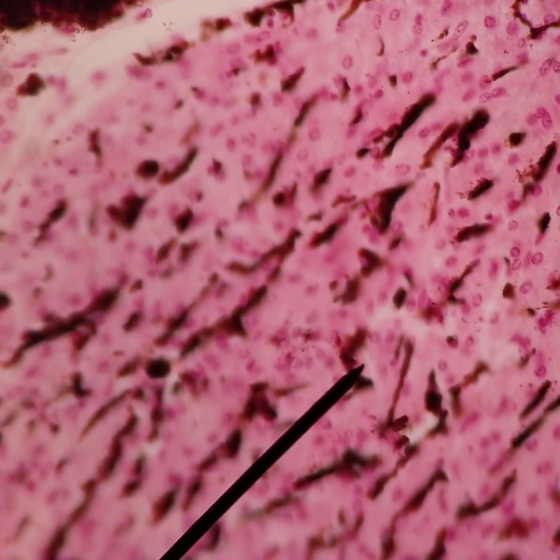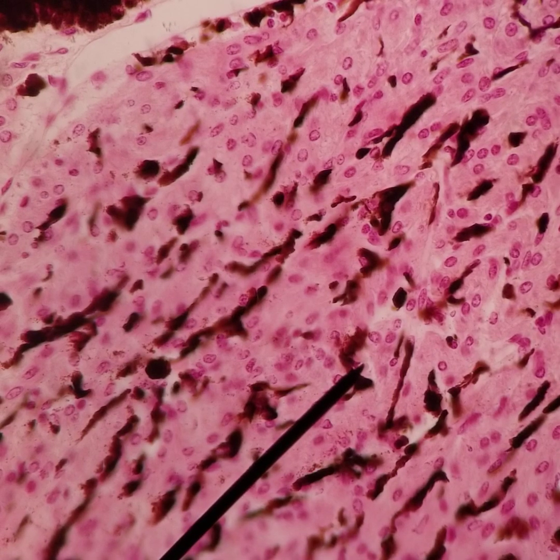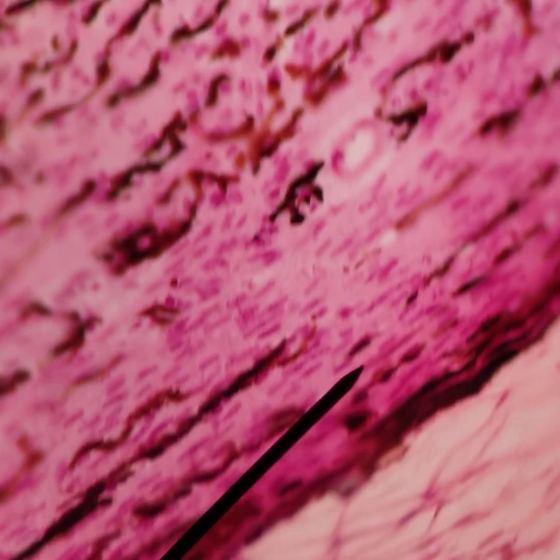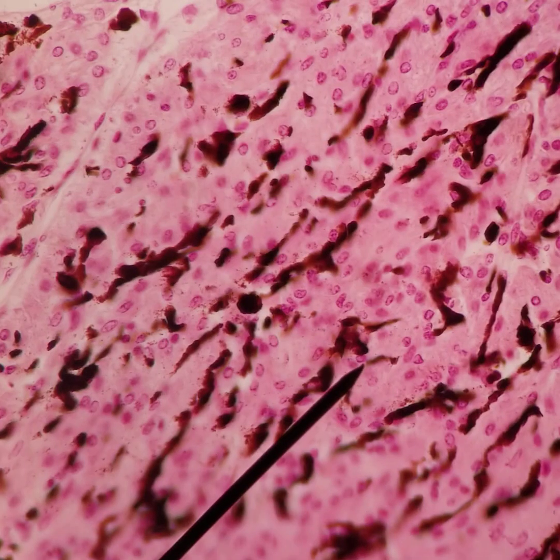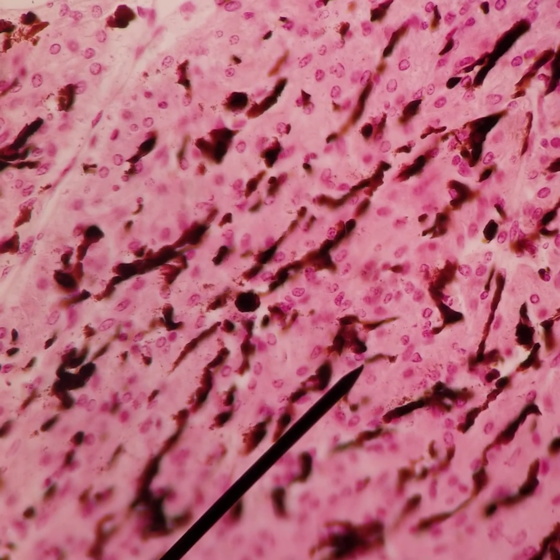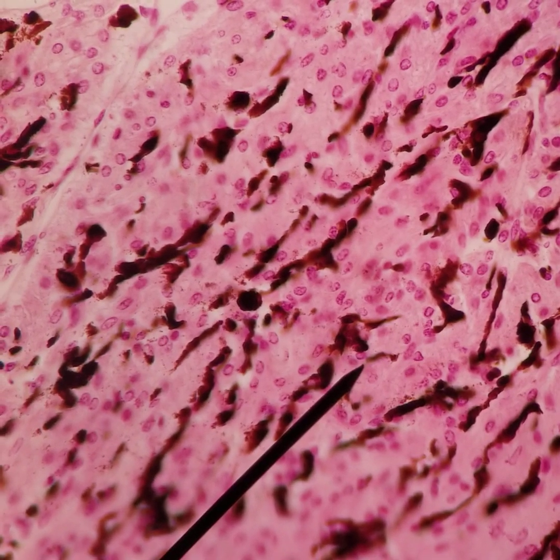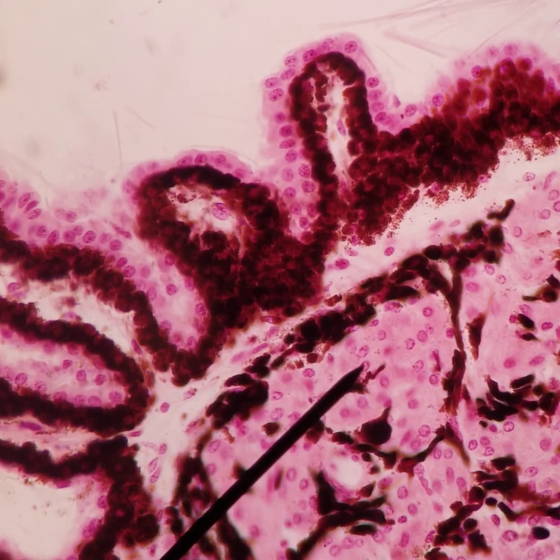Within the ciliary body we have connective tissue and muscle fibers. Looking at the diagram from the lecture, those different sections of muscle — out here they're running more linear, and you get more cross-sections as you move more internally, but it's hard to really differentiate layer from layer.